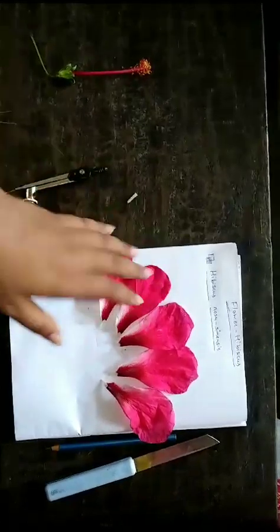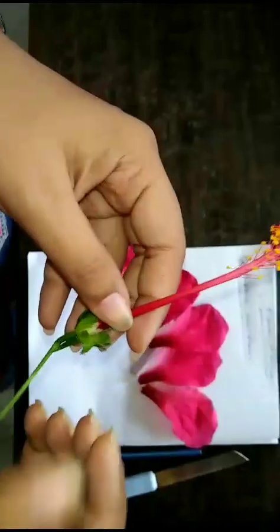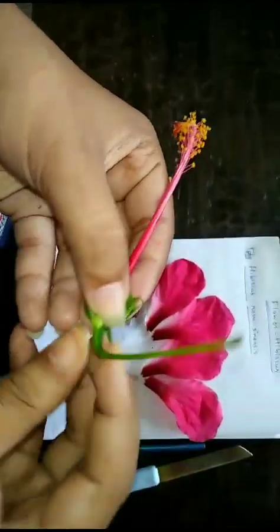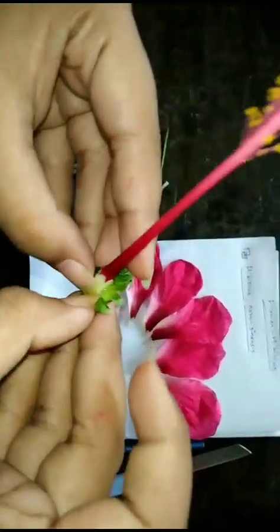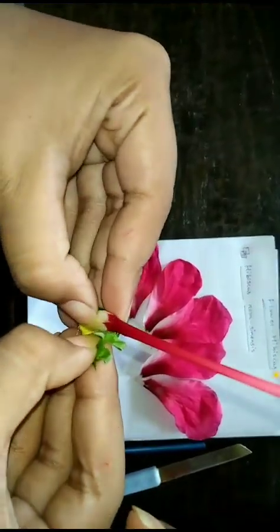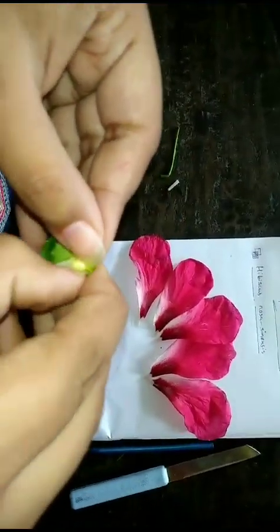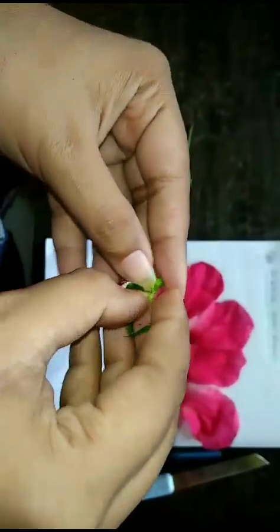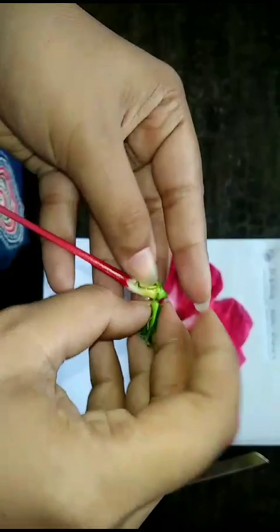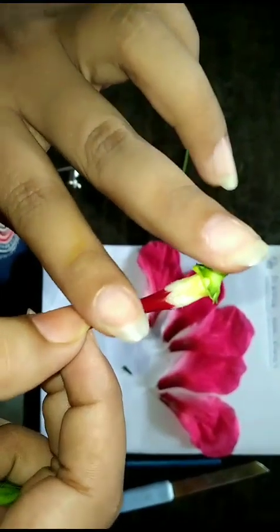These colorful petals attract the insects for fertilization. Now we are going to separate the stem, which helps the flower to be connected to the plant, and this is calyx, which helped the flower when it was a bud. So we should not separate these two parts during dissection. Now these are the reproductive parts of a flower.